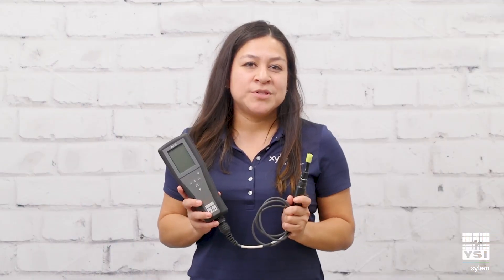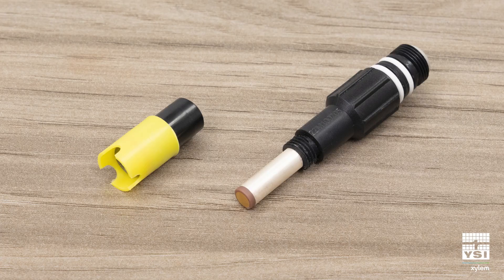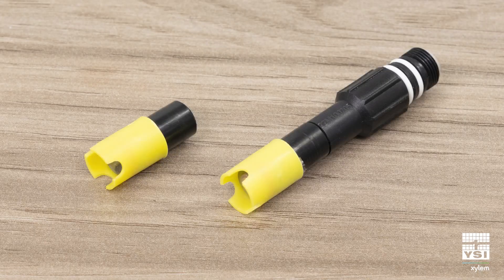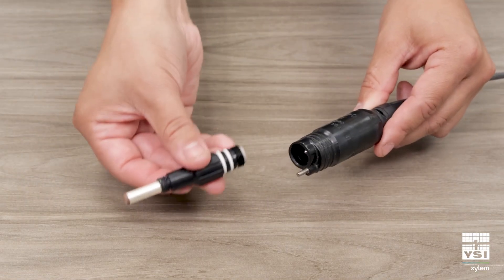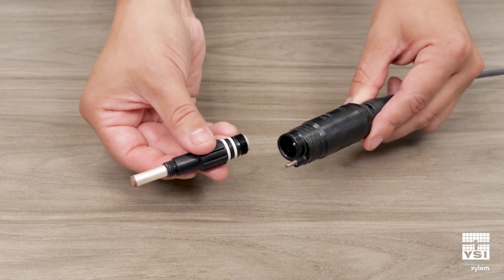In this video, we'll show you how to install a membrane covered dissolved oxygen cap on your Pro Series DO sensor. You'll need to install a new cap on every new membrane DO sensor. You'll also need to replace the membrane cap every few weeks or as needed. The sensor can be installed or uninstalled in the instrument when you replace a membrane cap.